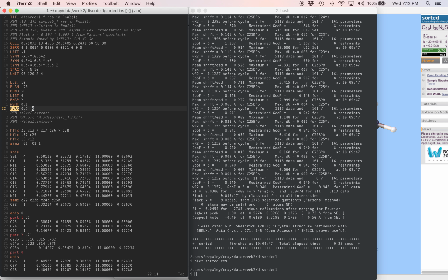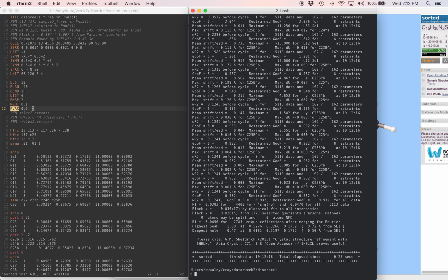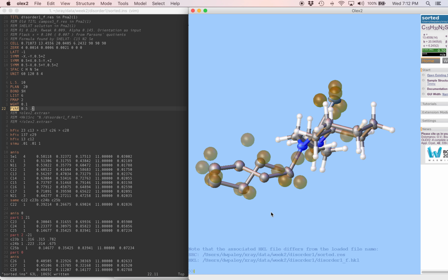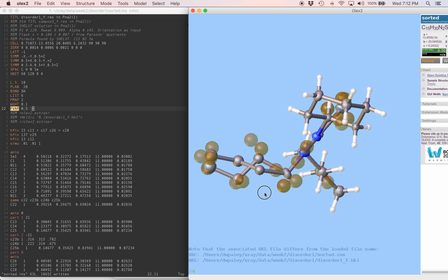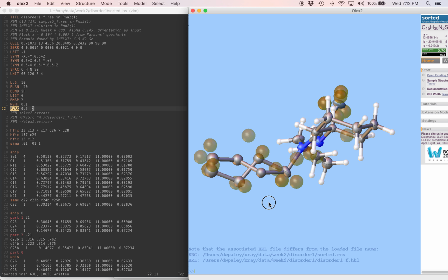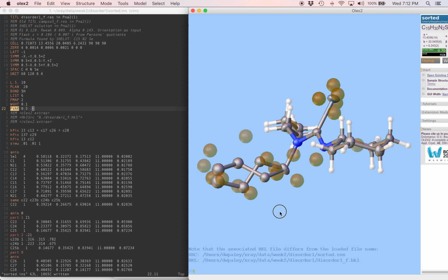So that's putting an extra parameter in our model. It's that easy, and that number is going to get refined. So it doesn't matter too much exactly what I type in right now. We'll run this again with the occupancy ratio refined. We can see that the R factor dropped again by just a bit. We could already tell that it wasn't too far off here. And yeah, now the displacement parameters of the two disordered parts of the chain each look pretty reasonable.